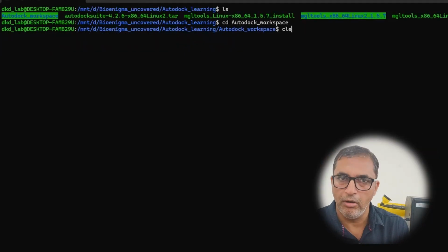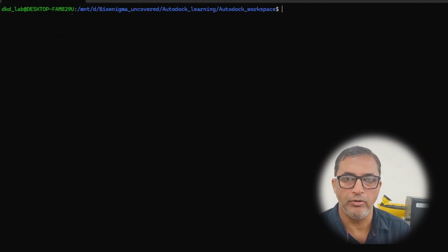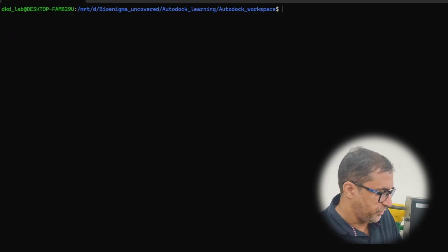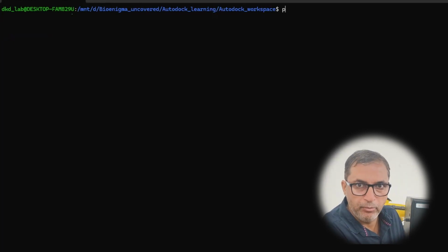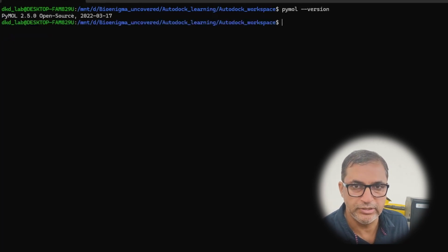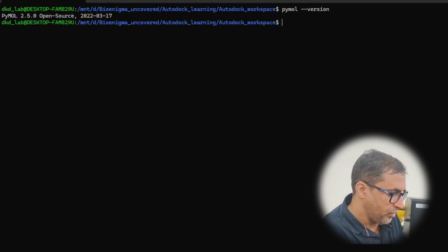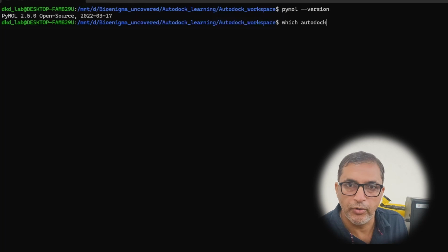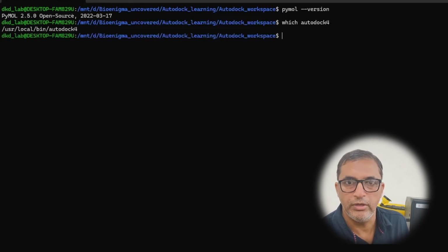So once all these four softwares are successfully installed, we are finally going to check the PyMOL version here, and we are going to type pymol space --version. It will give you the exact version of the PyMOL which has now been installed on our system. In the next step, we are going to check our AutoDock tools. So we are going to type which autodock4, and it will give us the location of the AutoDock 4 which has been installed into our PC.